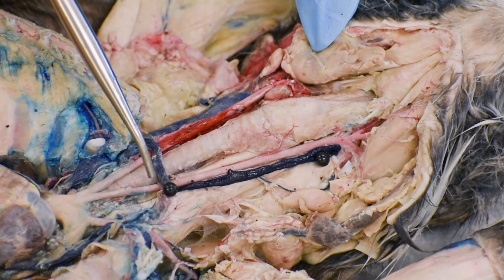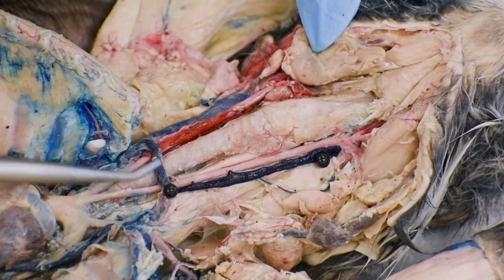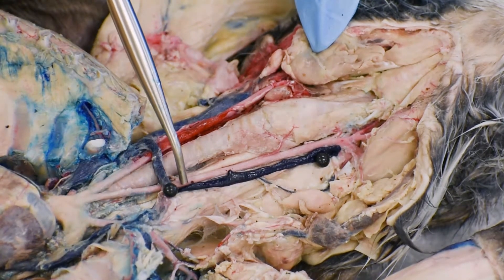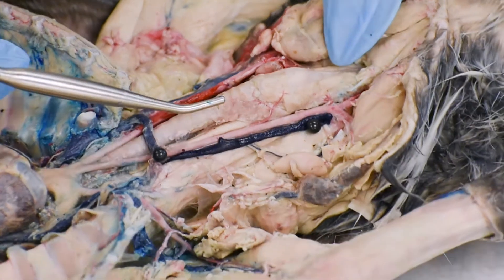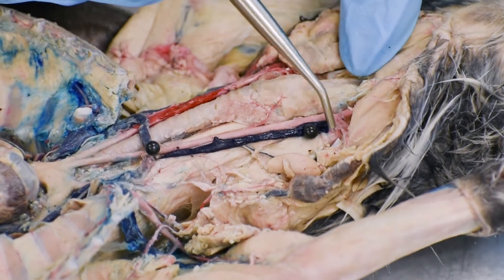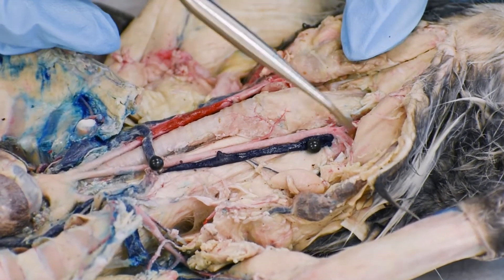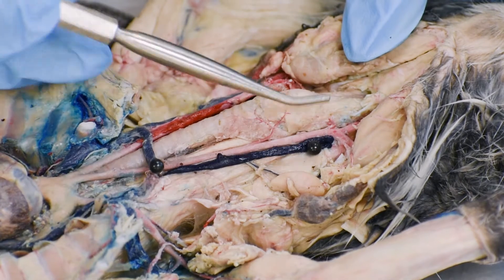Now we are following superior from the heart. Here are the left and right common carotid artery. The common carotid artery will be branched into internal and external carotid. If we see here, there are very nice branches of the carotid artery.